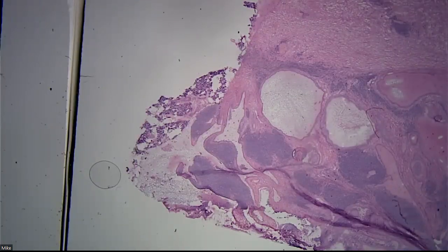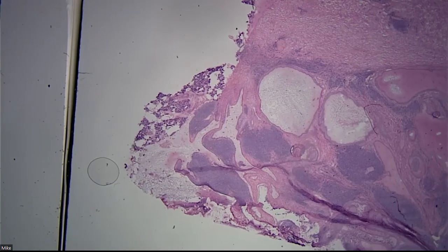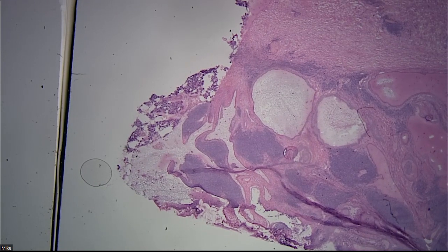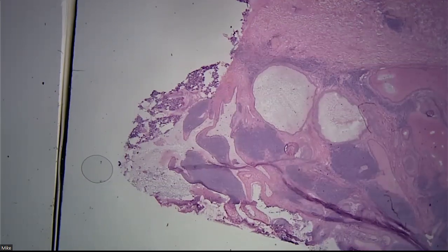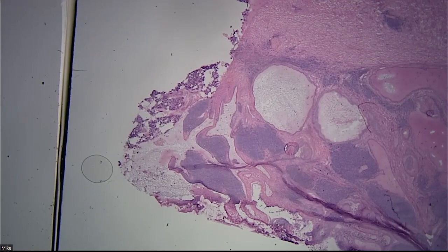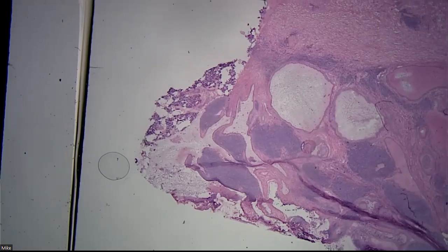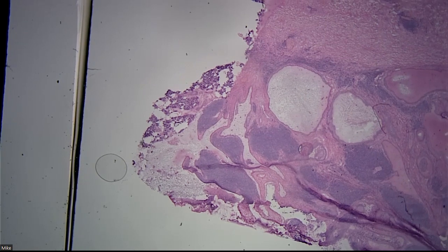So the clinical history here, which I didn't flesh out, all I said was 72-year-old male with left parotid mass, but apparently he has bilateral parotid masses and an increase in size in one of them, which is why they're taking it out. So what do we know about Warthin tumors conceptually, biologically? They're very significantly related to people who are smokers. They're often multifocal or bilateral, right? And how do they often present? How are these detected? Cystic?